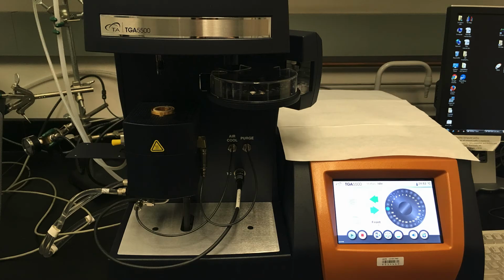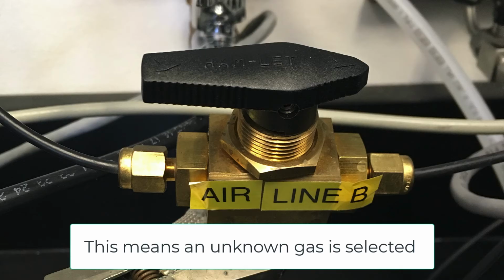After choosing your gas in the software, you will need to physically check that the gas line is in the correct position. If you are looking at the instrument, you will see on the left-hand side there is a gas switch. You will take a look at this gas switch. You will see if it is in the position pointed towards line B. This is for an unknown gas. This is for the setup if you want a different gas other than argon. For the purpose of this training video, we are only using air or argon.